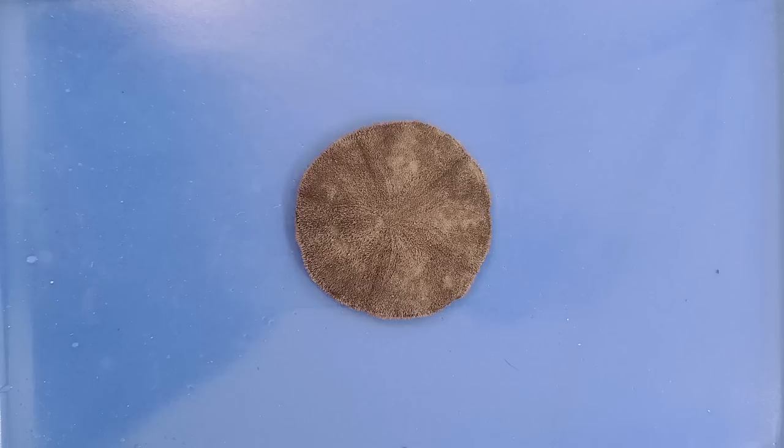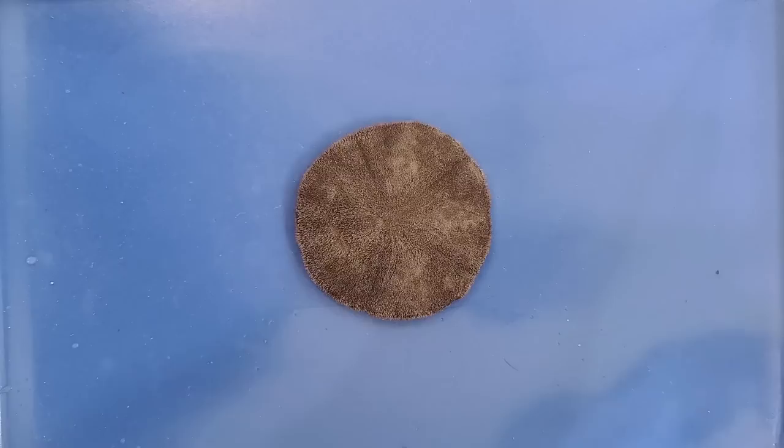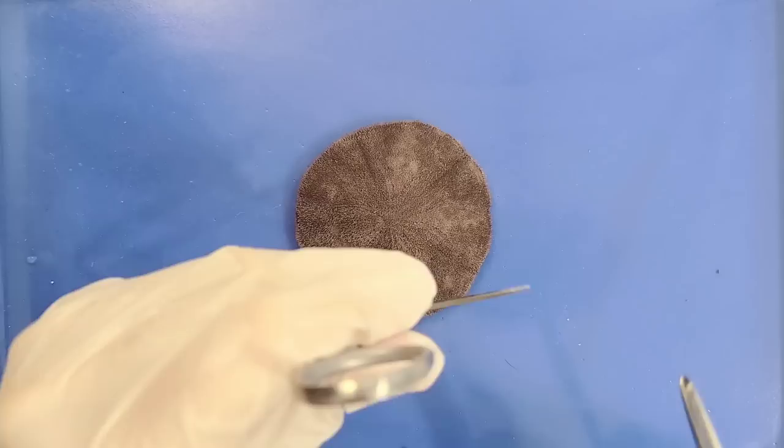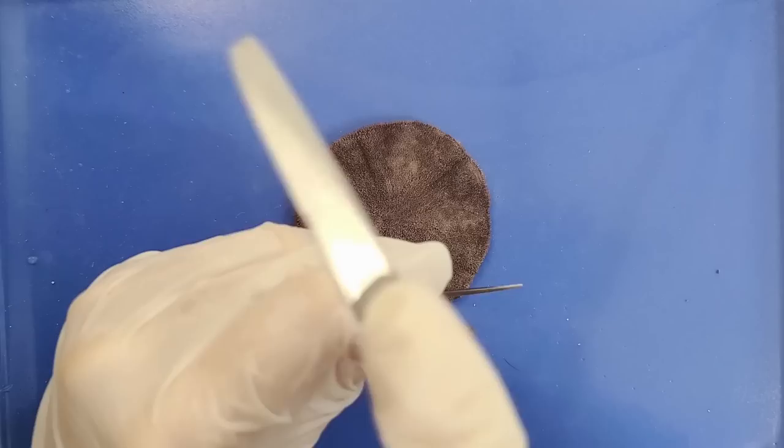Now let's take a look at the internal anatomy. Dissecting a sand dollar is actually pretty difficult — first because the test is very hard and difficult to penetrate, and also because the organism is very flat, so all the organs are close to the surface and can easily be damaged. First, you're going to need to chisel yourself a hole. Start around three-quarters of the way from the center, because if you go too far towards the edge it's hard to cut, and if you go too close to the center you might damage the organs.